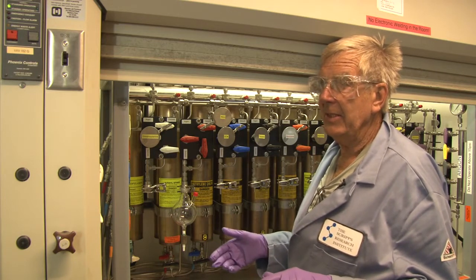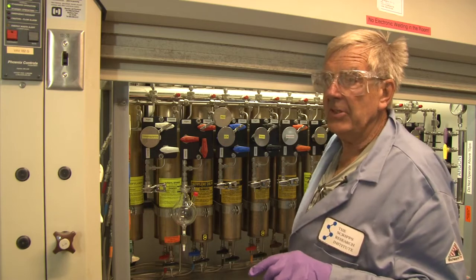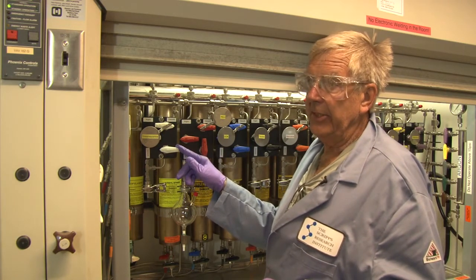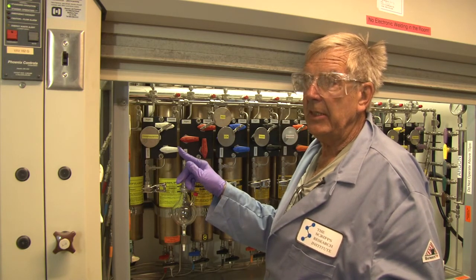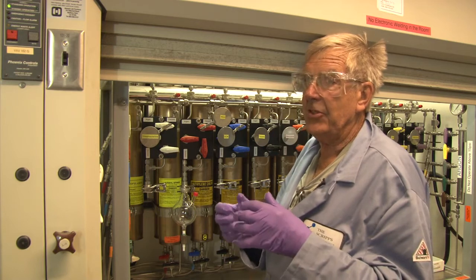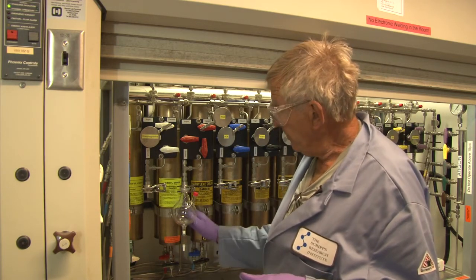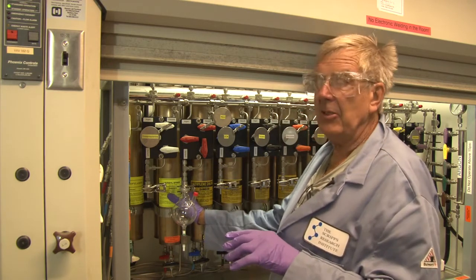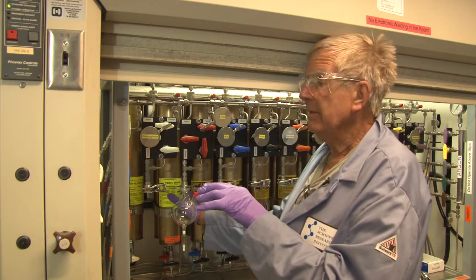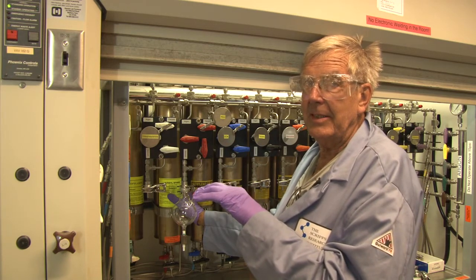The idea is to get an anhydrous anaerobic solvent, so you do not want to start with bad gas. Regarding solvents: ether is always stabilized with BHT. THF is never stabilized because it polymerizes, which turns the drying bed on THF into a snotty, clumpy thing and ruins the columns almost instantly. THF, ether, and some others will develop peroxides, but only in the presence of oxygen and light. Since there is neither in proper operation — but stressing again, if you do have bad gas, you will generate peroxides.